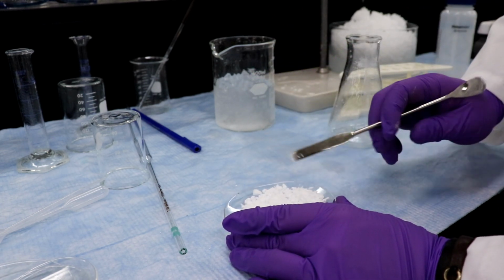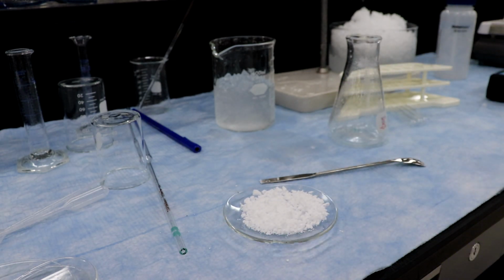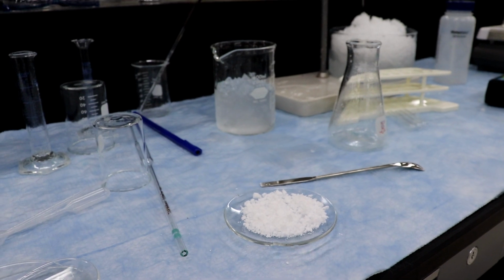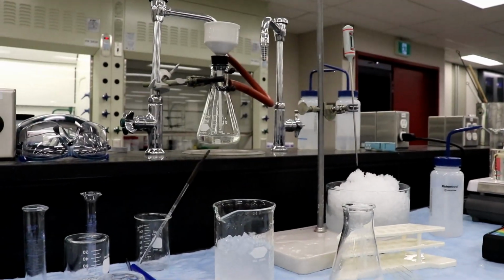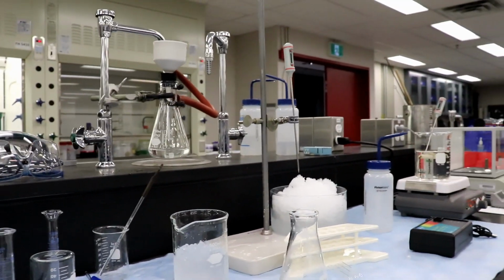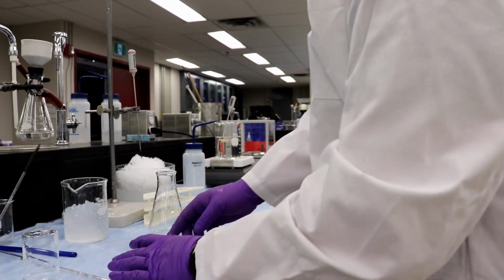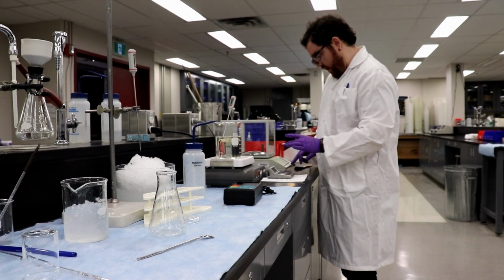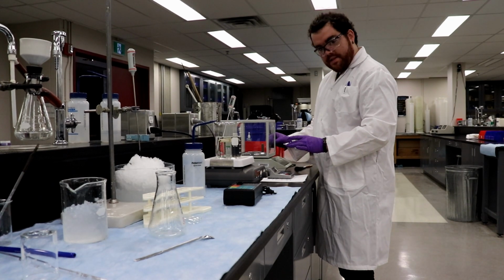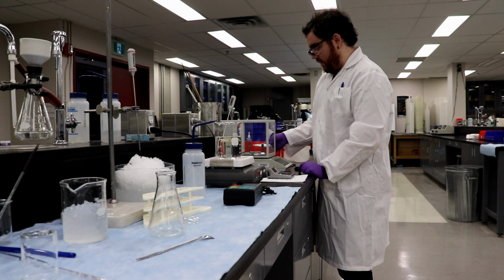Okay, looking pretty good. So I want to weigh this now, right, Ingrid? Yes. Okay, perfect. So this is the part where we move it over, and then I slip and drop it all on the floor. We start from scratch. So let's hope that doesn't happen. Okay. So we pre-weighed this weigh boat, so we know how much it weighs already. So I'm going to tare the balance before I put it on here. And this is the largest weigh boat. Okay.